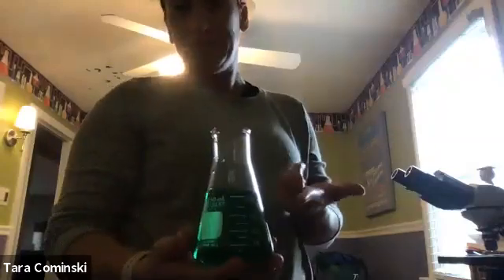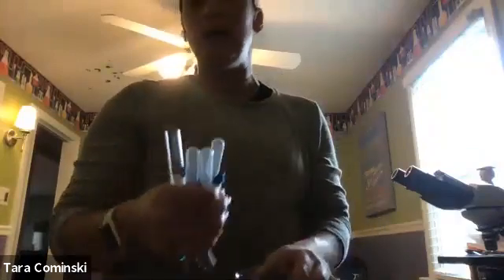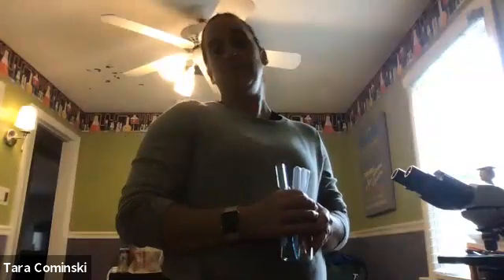Another thing I might as well point out: this is a flask, and you can see that this has graduations on it too. So you can still measure volume using this. This is not as accurate as a graduated cylinder. You also have beakers in the lab. Same thing, they give you estimations of volume, but not really an accurate way of measuring exact volumes. You would want to use that graduated cylinder like we did. And we talked about converting as you moved through. All right, so I'm going to end this. I will start a new recording for the microscope part of this lab.